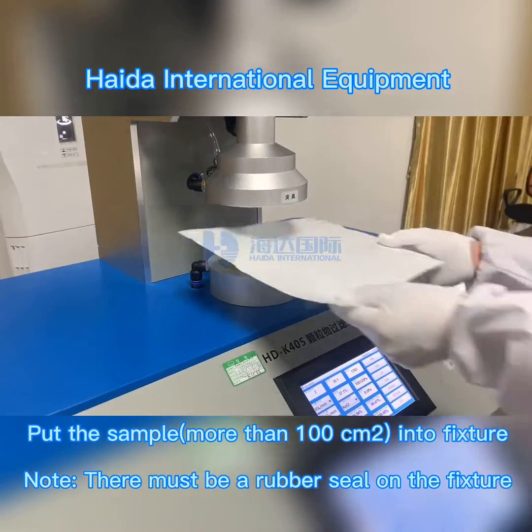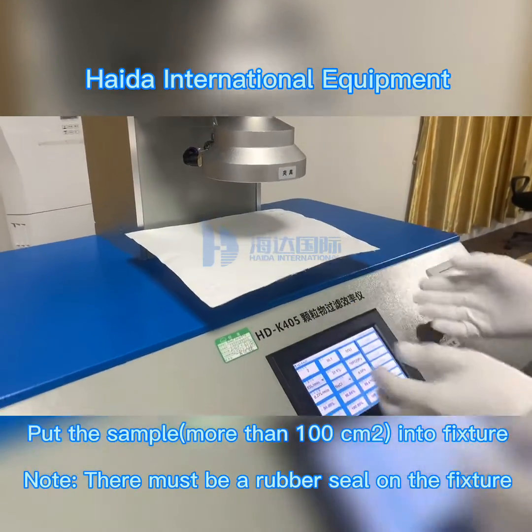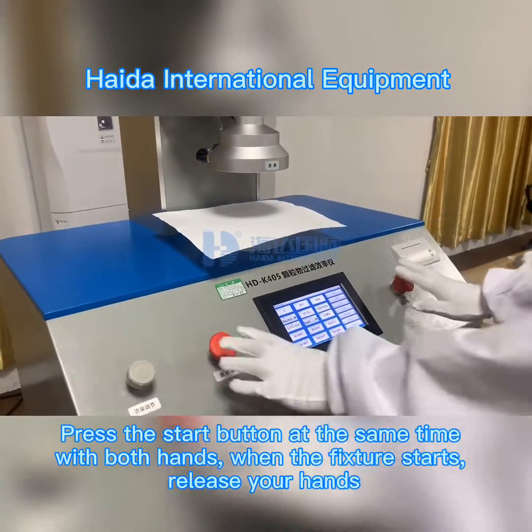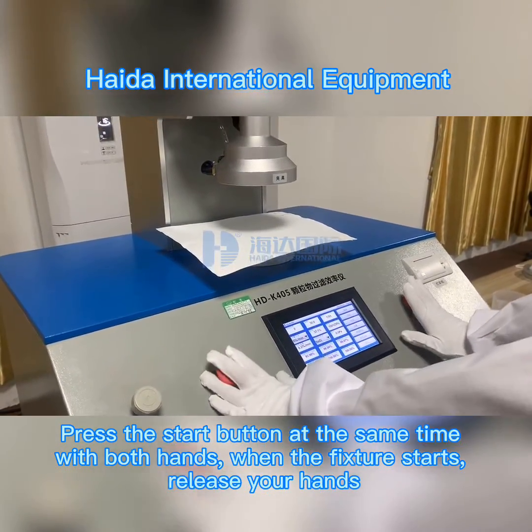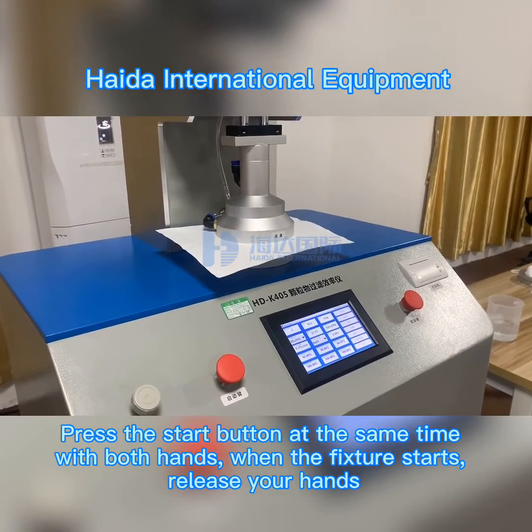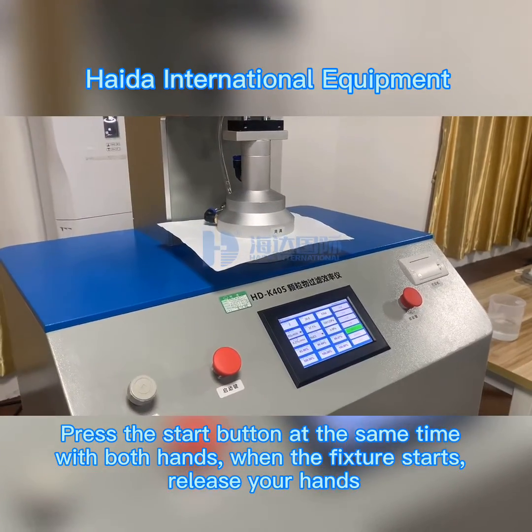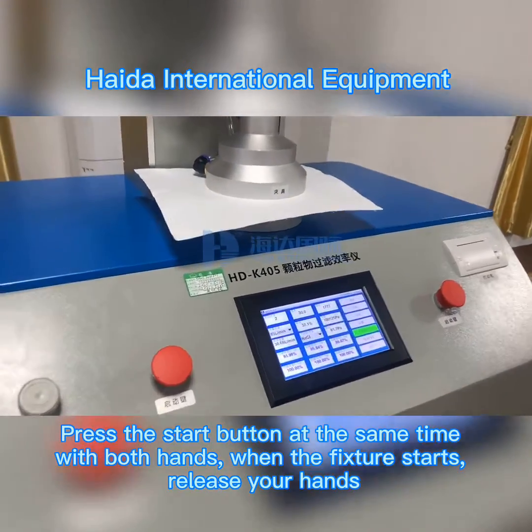Put the sample — more than 100 cm² — into the fixture. Press the start button at the same time with both hands. When the fixture starts, release your hands.